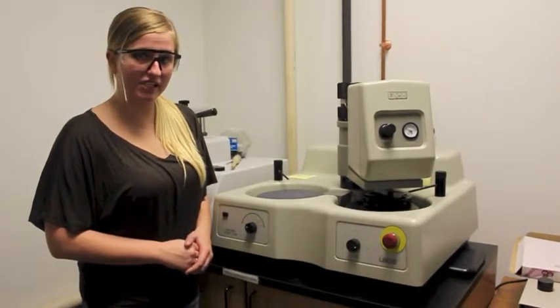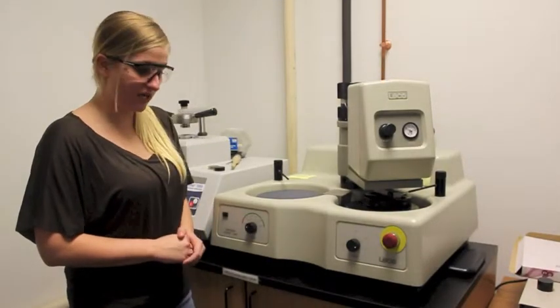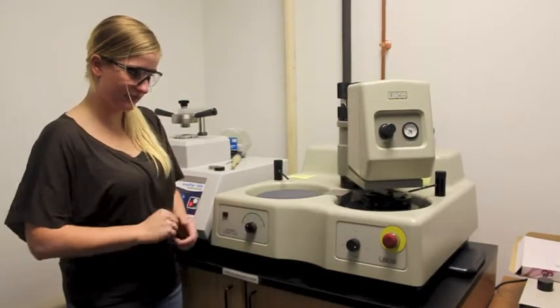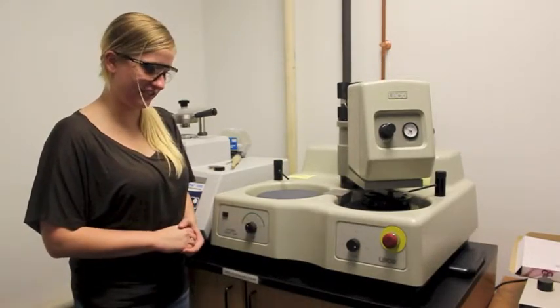Now that you've selected your parameters, you can start the machine by selecting your time. For our example, we are using 30 seconds. The machine will start after you select your time.